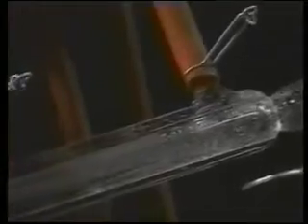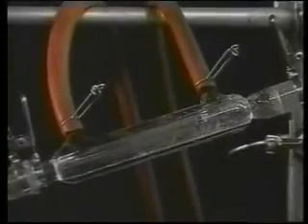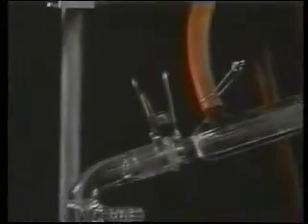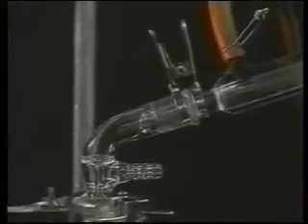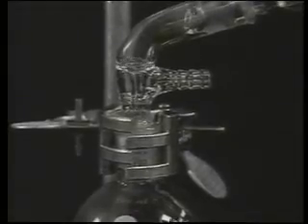Shortly after the reflux ring reaches the thermometer, the temperature reading should rise sharply as vapors begin passing through the sidearm into the condenser, coalescing into droplets that run into the receiving flask. As the first few droplets come over, the thermometer reading should rise to an equilibrium value. Record the value at which the temperature stabilizes, and check the thermometer reading frequently throughout the distillation. Distill the liquid at a rate of about 1 to 3 drops per second.